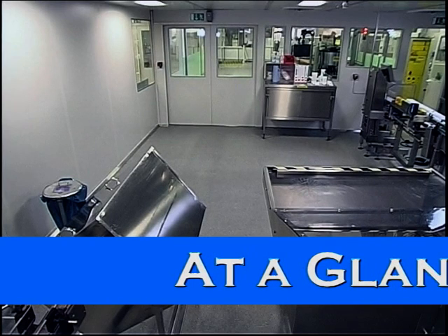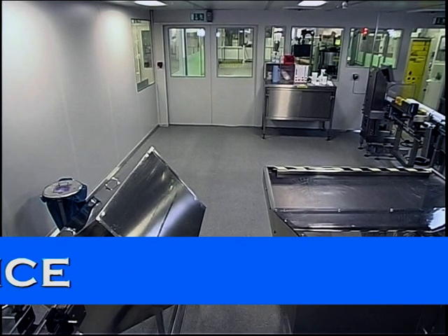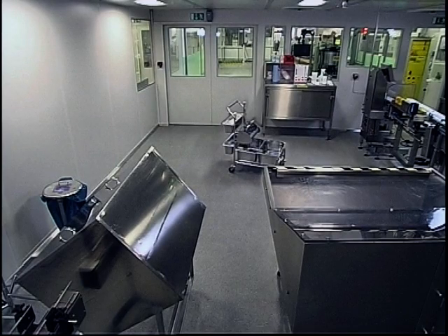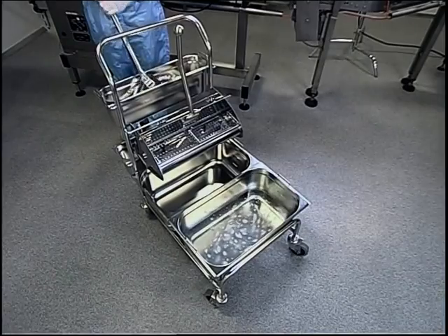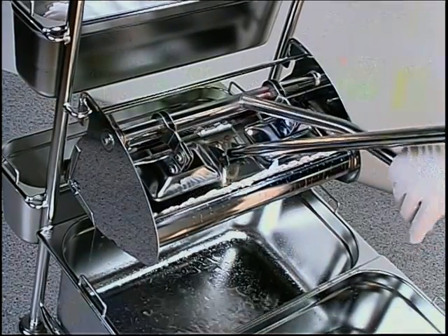Let me briefly summarize everything, as that was rather a lot of information to take in. Before wiping, divide the room into imaginary 10 square meter sections. You've got enough mops with you. Then position the trolley in the right place, more or less in the middle of the room. Pick up the mop, immerse it in the disinfection solution, and wring out.